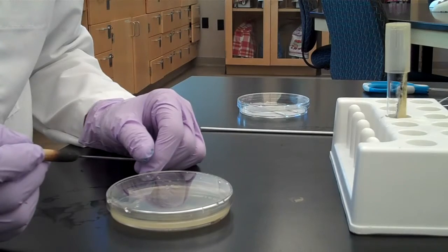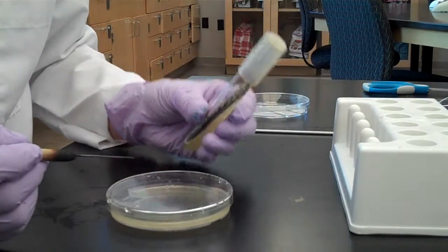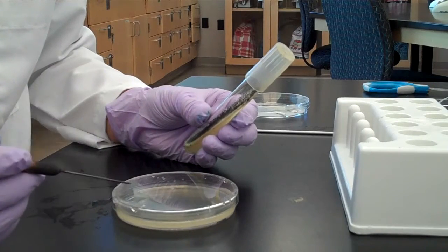Now we're going to demonstrate the subculture of mold assignment. We're going to use the same SDA agar plate that we just cut the brick out of.